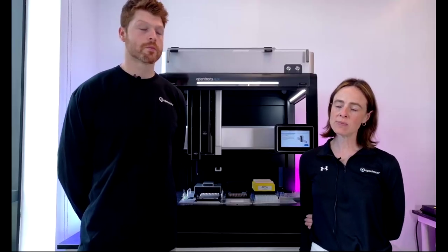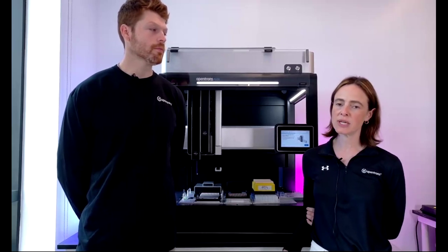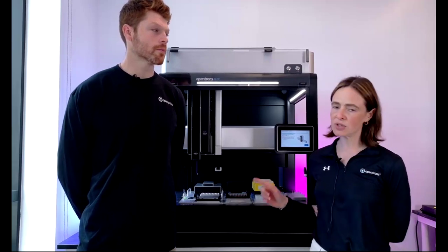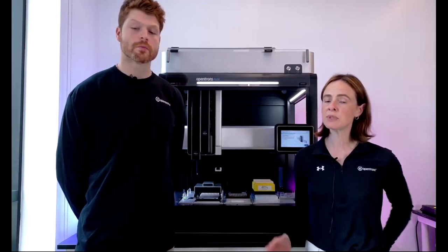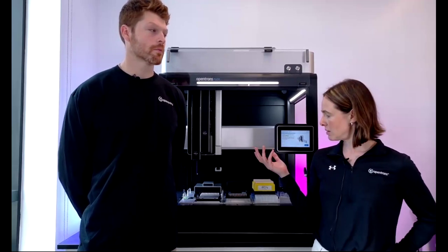Great. Flavio, with another question, are the digestion modules also an Opentrons product? Interested in an acid digester? Ooh, interesting. So we don't have any modules specifically for digestion. The trypsin digestion that we're doing here is really just using the thermocycler for the incubation steps, adding the trypsin, the DTT, IAA, and ABC reagents at the appropriate points, and then using the thermocycler to do the digestion. So we don't have a specific module for acid digestion.